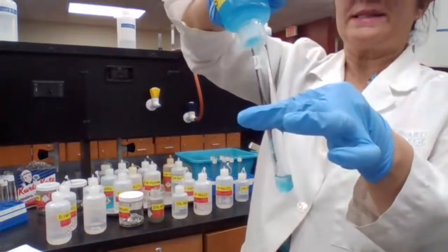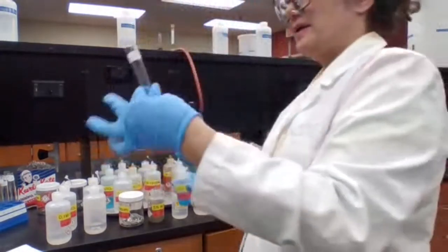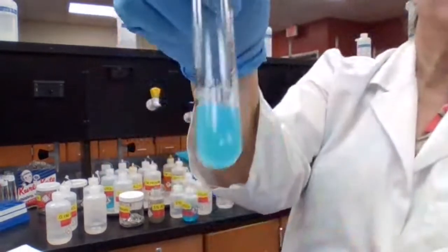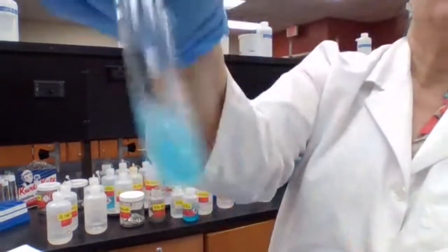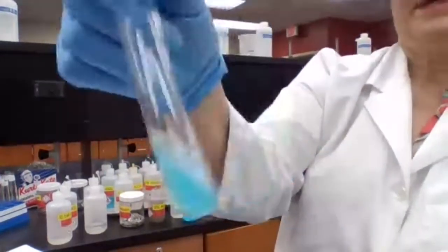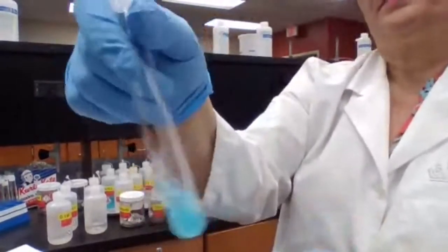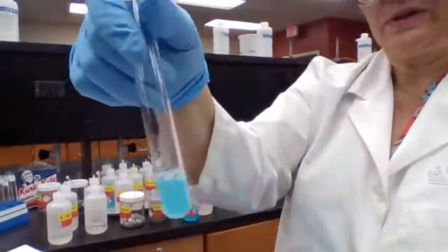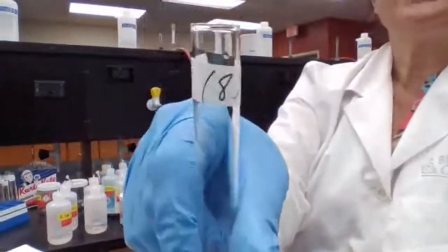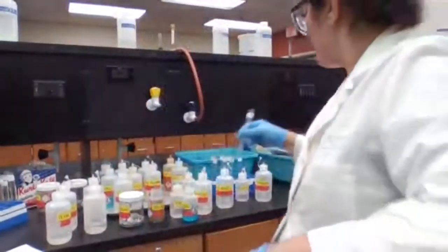The blue color stays, but the blue color that we have for copper sulfate is a clear blue color, but this one is cloudy, so there is a reaction. Okay. Blue color precipitate that changed the solution to cloudy, a mixture of solid and liquid. So test tube 8, yes, reaction, and you have blue color precipitate.